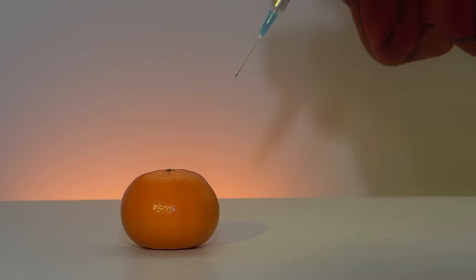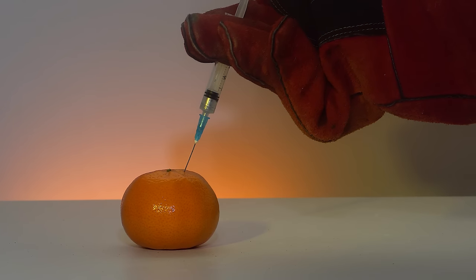It was interesting to see how the tangerine would behave given its denser peel compared to that of a tomato.